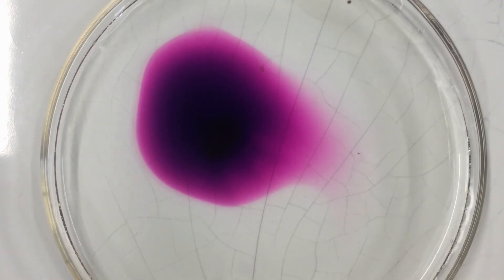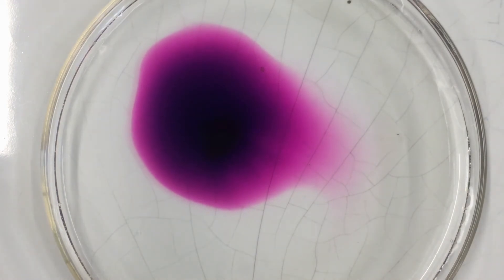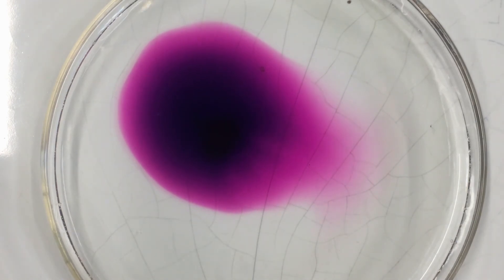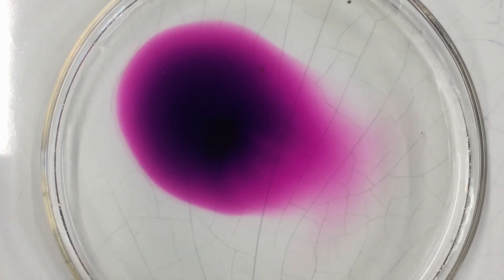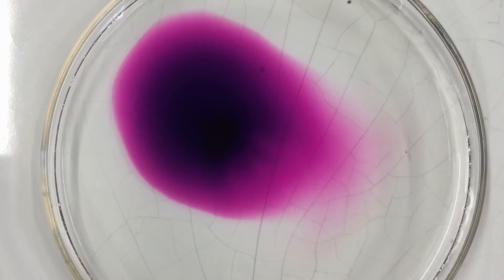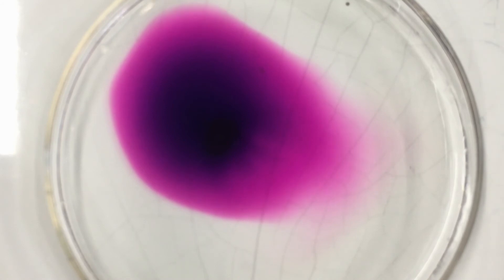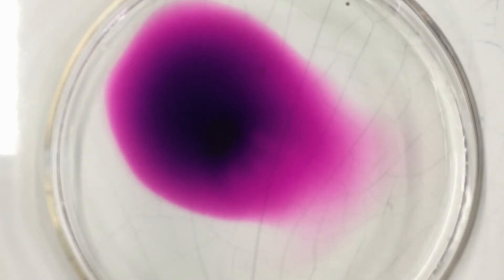Then we proceed to observe the actual diffusion process, like the intensity of the color and how it varies. If you notice, the color at the center is very intense — a very dark purple — and as it begins to spread, the color fades. Also notice the speed at which the diffusion occurs. While we increased the speed of this video, this is actually a very slow process.